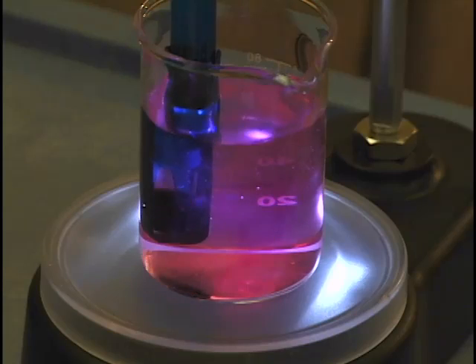We'll let it keep dropping a little while longer so we can get an upper tail on our titration curve and come back and analyze it.